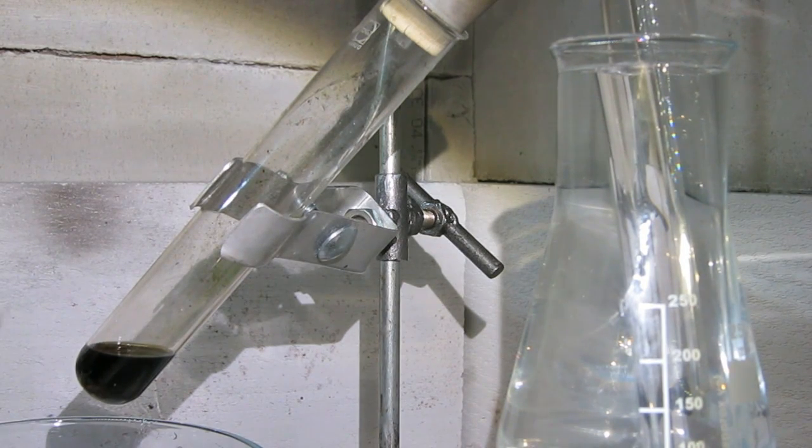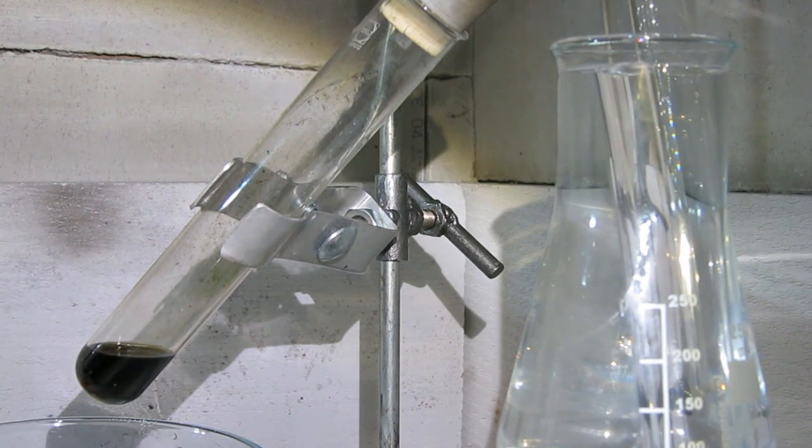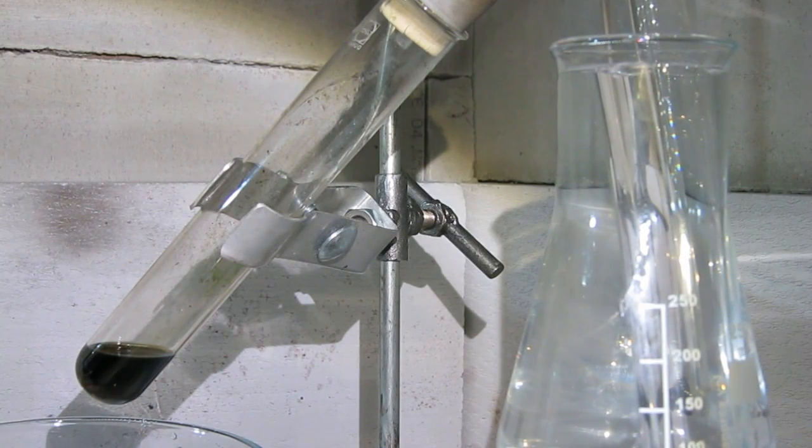And this cup of water is just in case the test tube breaks and everything falls into the water, and there is no danger. Ok, turn on the fume.